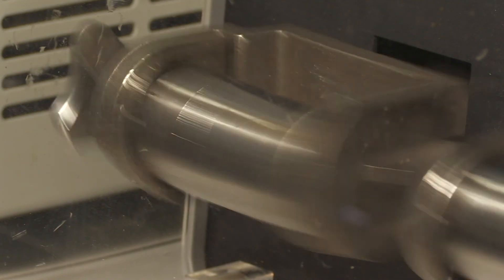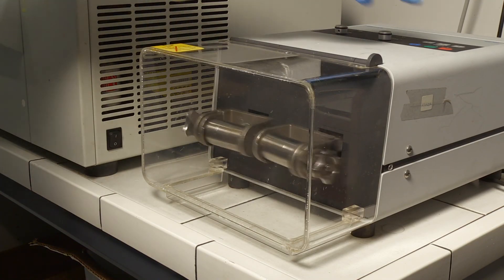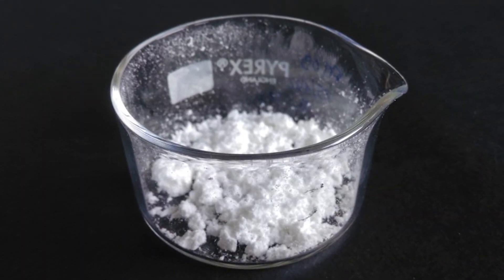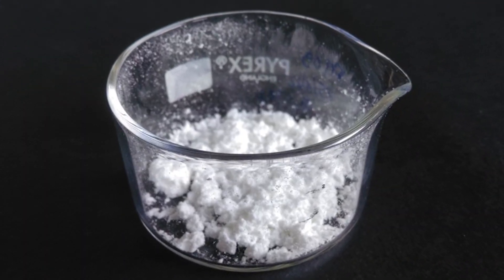Mechanical mixing allows essential oil complexation with beta cyclodextrin molecules. A powdery sample of encapsulated essential oil is obtained at the end of the procedure.